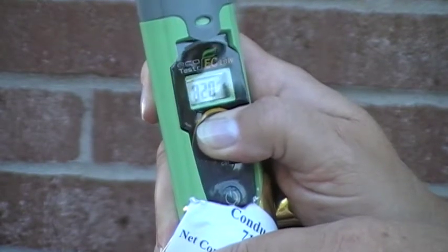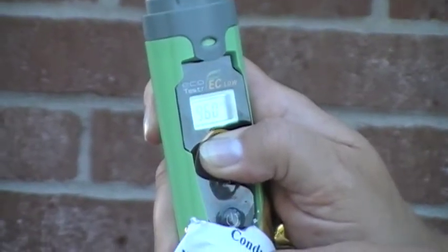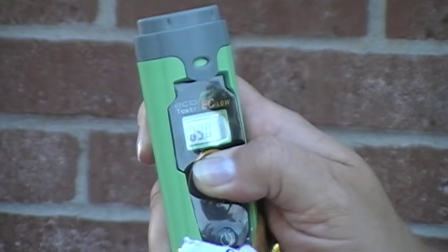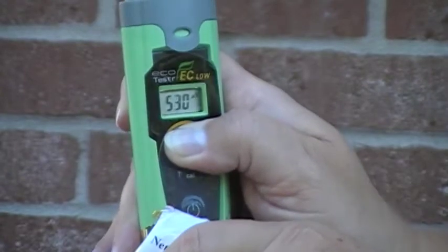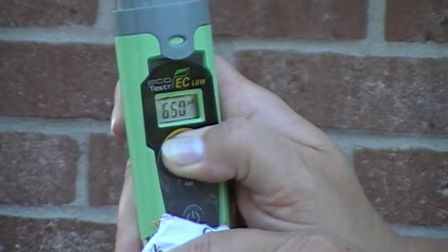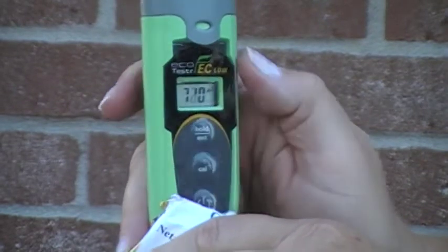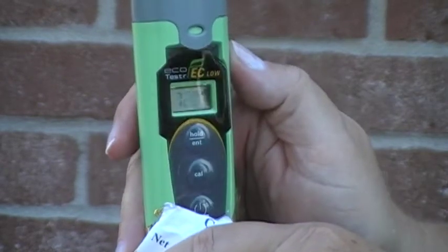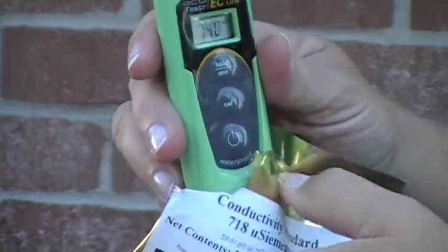I've gone past 720 talking to you, so I'm going to keep holding the button in. Once I get to about 670, I start letting off the button and pushing it separately until I hit 720. Once I get to 720, it will flash and it will say ENTER.